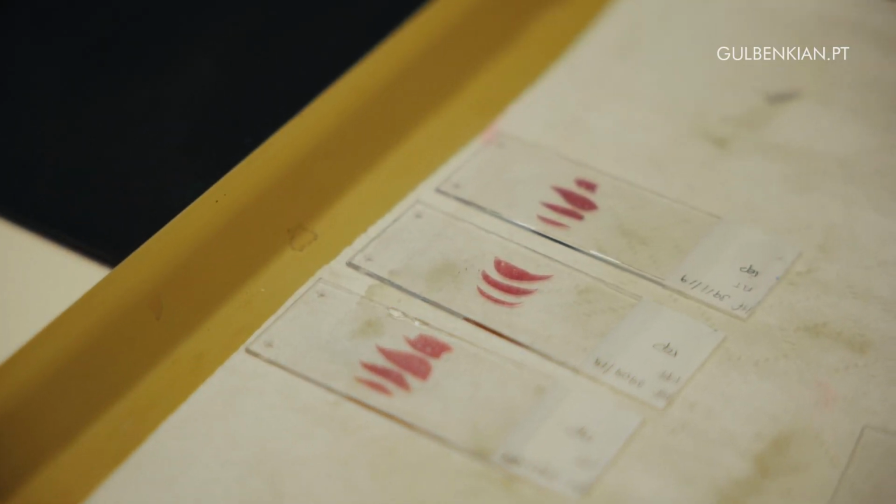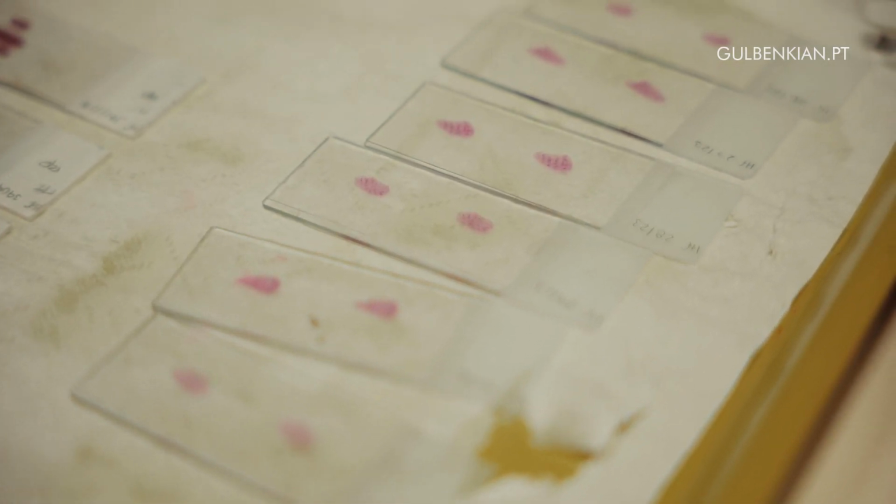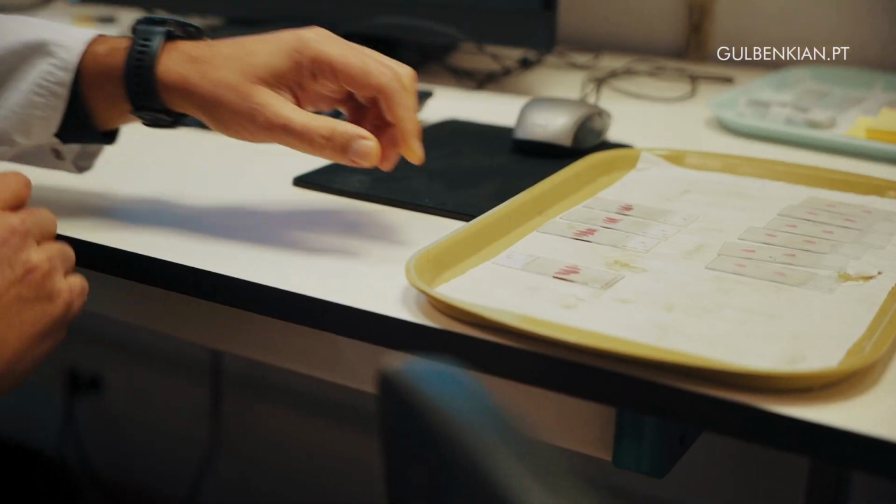My name is Pedro Faísca, and I'm the head of the Histopathology facility here at the IGC. The added value of having this technique here at the IGC is that we have multidisciplinary facilities that are working together, and so we can do the whole process in the same place.